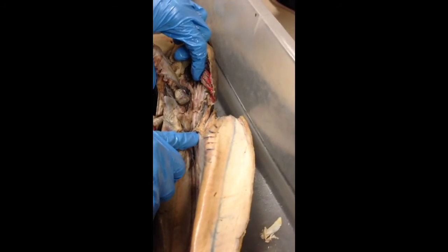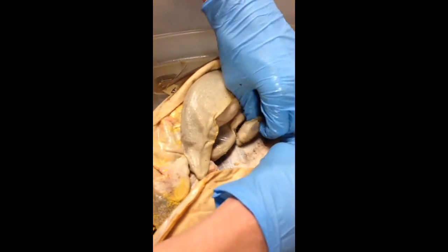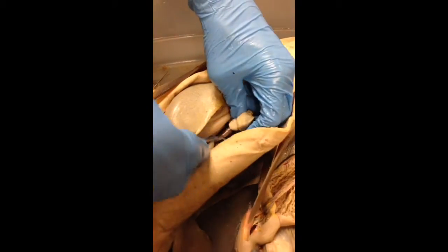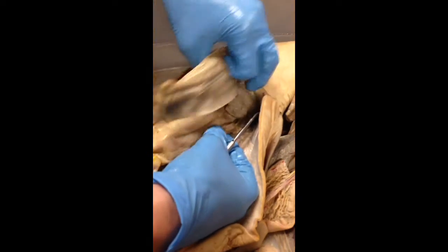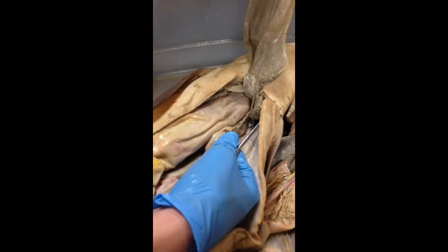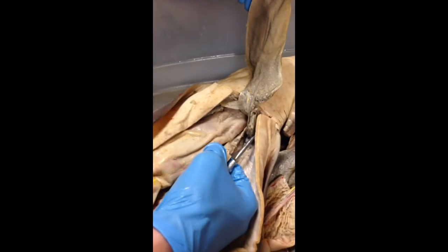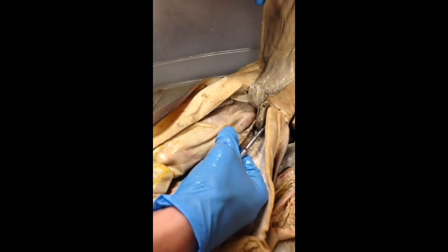Next thing is the ovary, and you can see it really easily on this female shark. It is a small section of tissue — like a flap. It's underneath the liver, and it's pretty easy to differentiate on the female shark.